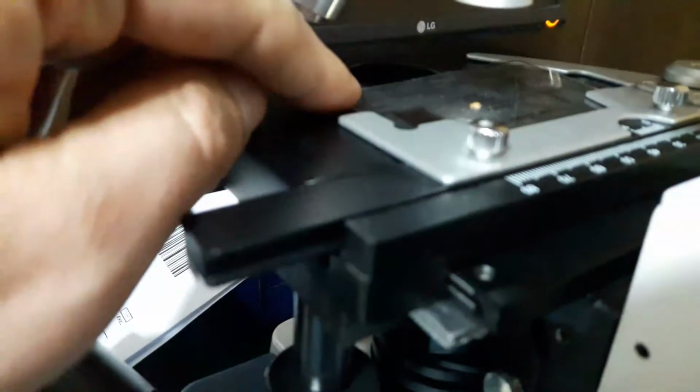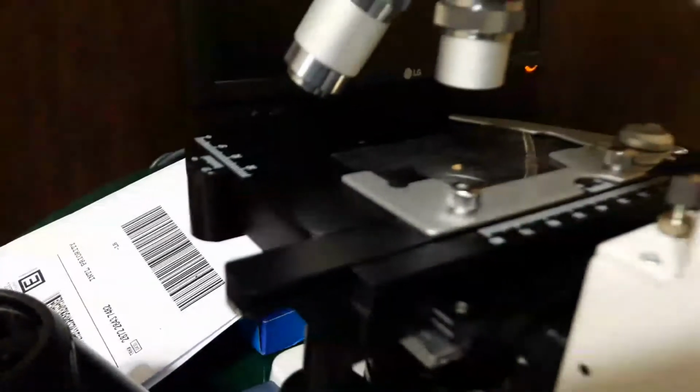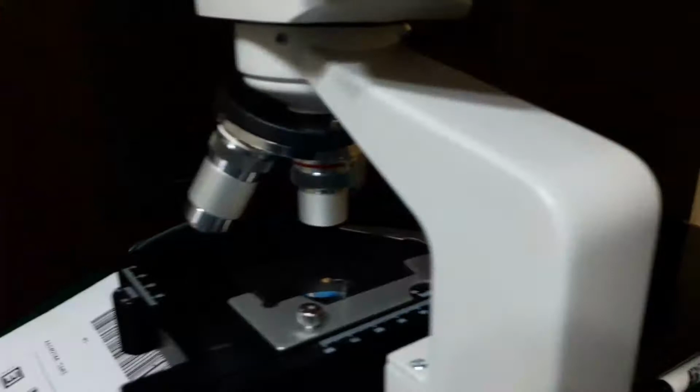Now you would ask why I'm using this piece, not a real glass slide. I do have glass slides, I'm just a hobbyist, but I find this convenient for quickly taking pictures. I'm not a biologist, not a specialist in such things. I just love to take pictures of minute stuff. So enjoy the views with me.